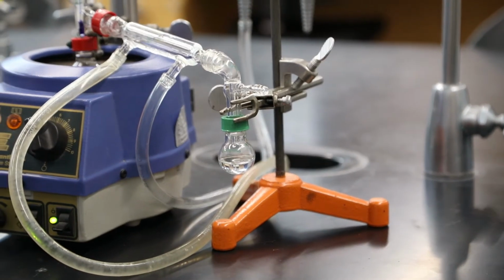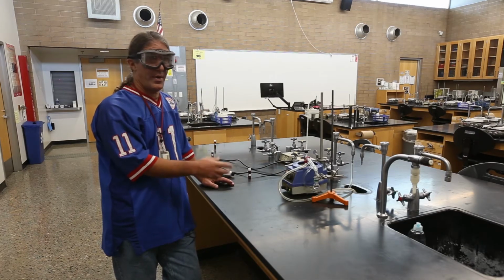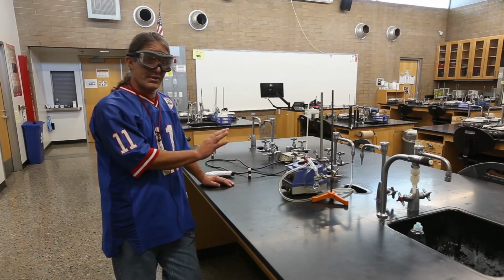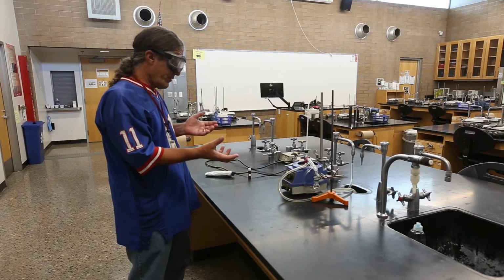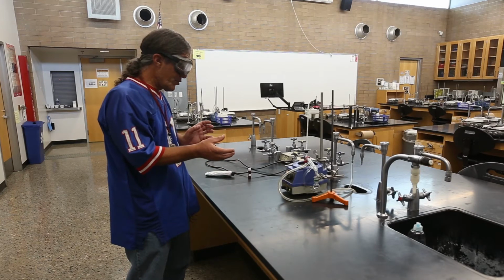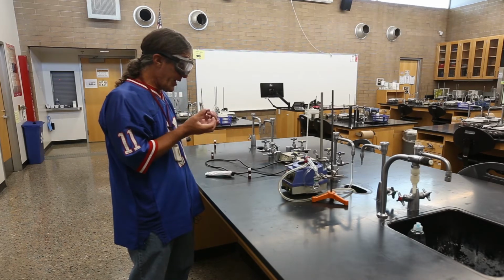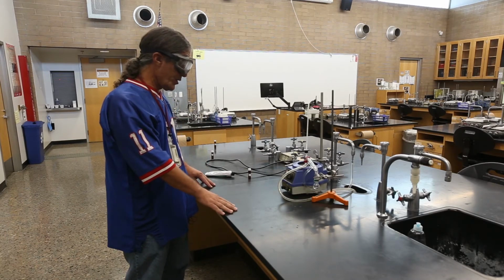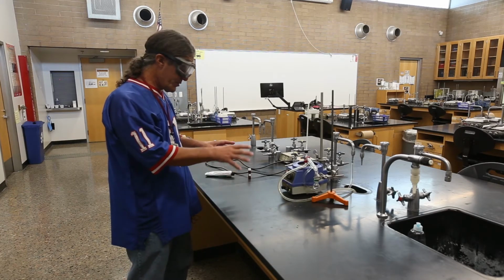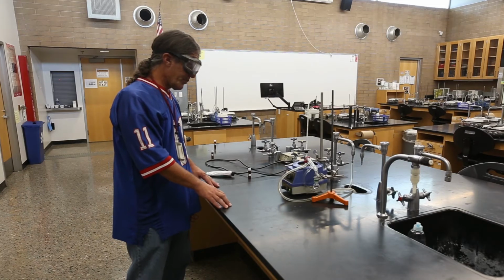This is another opportunity. If you're in a live lab, or if you're sitting at home thinking about this and questions pop into your mind, that's a great time to take advantage of the resource you have and ask questions. Even though there's nothing really happening here except the smooth distillation, we can be thinking about what's going on, and if we have any questions, we can ask and keep the mental engagement high, even though there's pretty much just watching this distill. And if all goes well, we don't have to do much except keep the heat on.